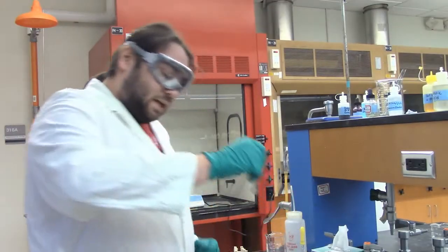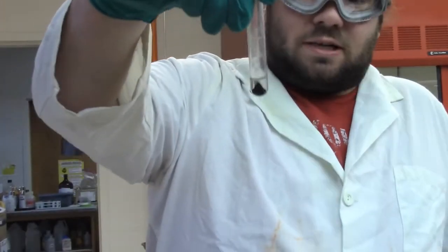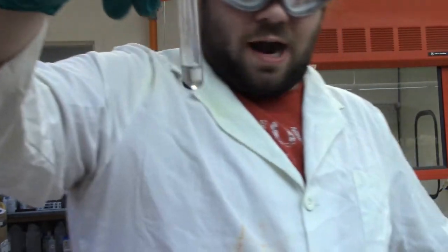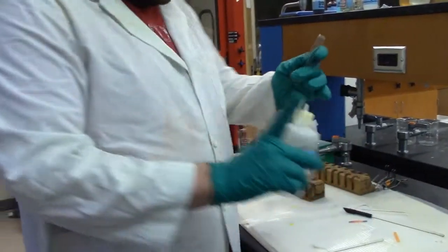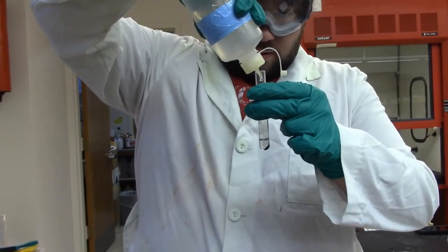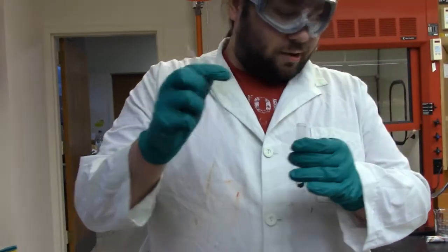So what we have left here is a precipitate, and I didn't mix in the water this time so you could actually see it. So we have some precipitate, and that is what we're using to test for our cadmium, copper, and bismuth. So I'm going to add a few drops of 6 molar HCl to this. I think it's only 2. Yep. I'm going to mix thoroughly, and I'm going to heat it, and I'll come back to you when we're ready to do our test for cadmium.